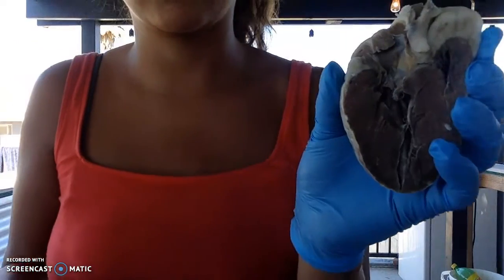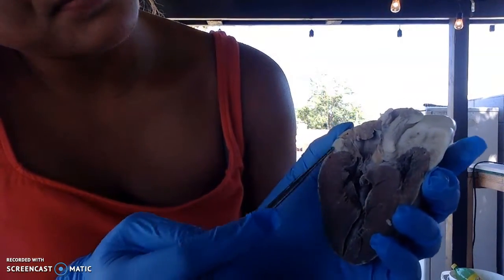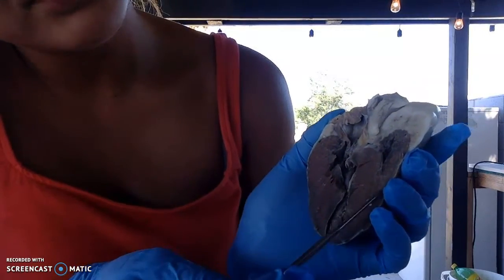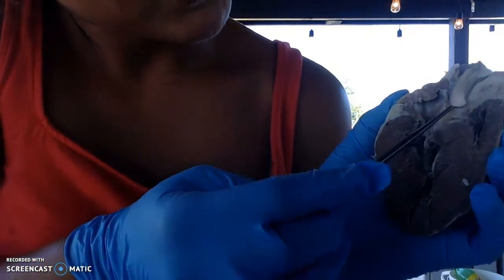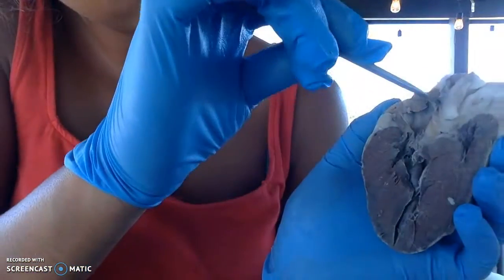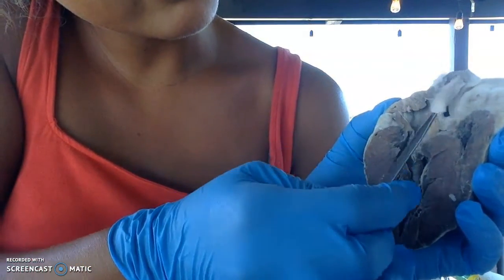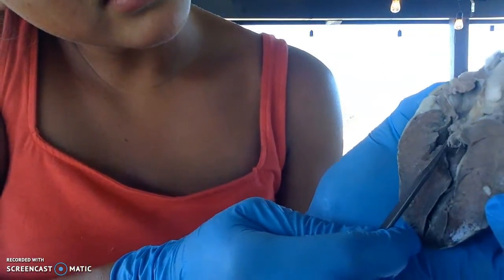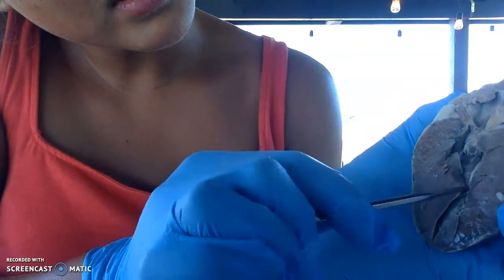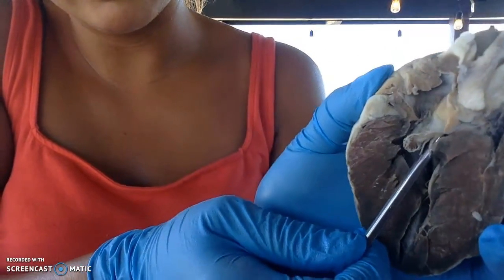Okay, then I flip around this way, and I'll show you again on this side. This is the right atrium, the left atrium, the right ventricle, and the left ventricle. Up here I have the aortic valve in between here. Put the aortic artery up here. Then I have the pulmonary valve under here on the left side. The pulmonary valve.